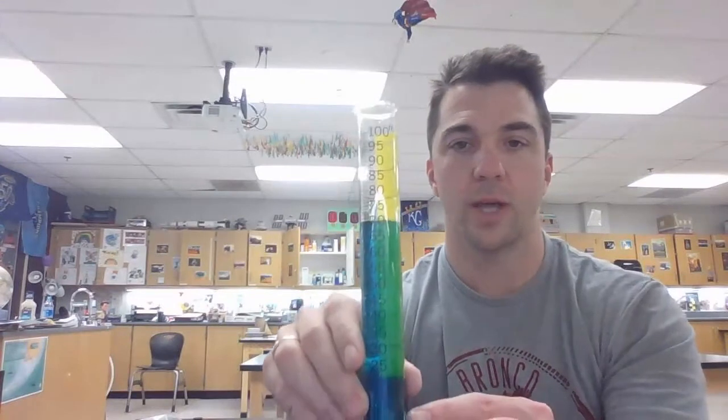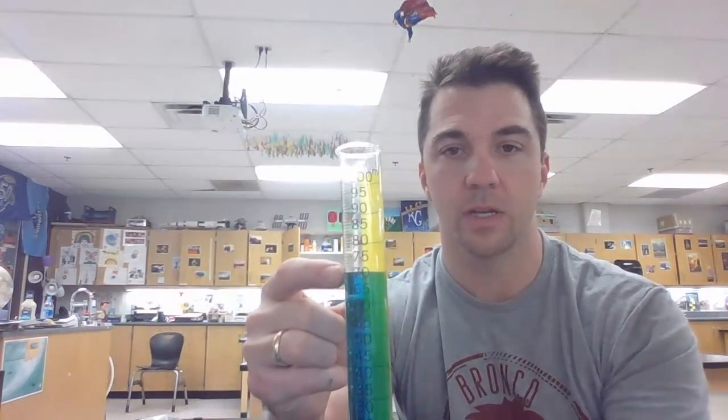Alrighty, so this is the volume portion of the data collection for this lab. Let me explain how we're going to do this. I've got a beaker of water with some blue food coloring in it, just so it shows up a little bit better in the graduated cylinder. I've put exactly 70 milliliters of that blue water into the graduated cylinder. It looks green because there's a yellow background, but anyway, 70 milliliters. That's how all of these are going to start, at 70. Unless something goes wrong, and I'll let you know, but assume they're starting at 70.